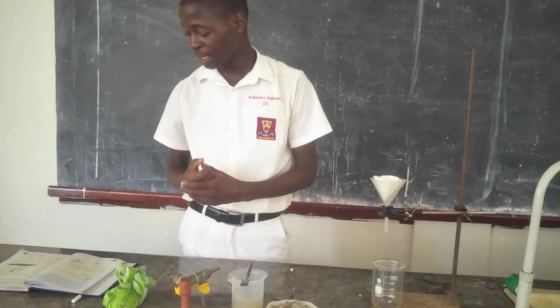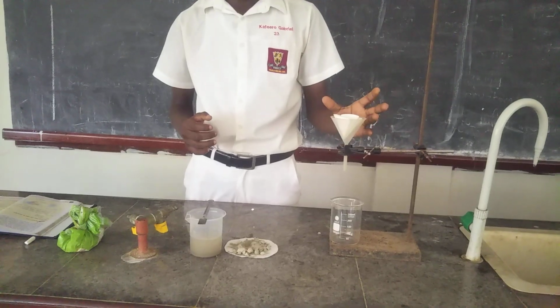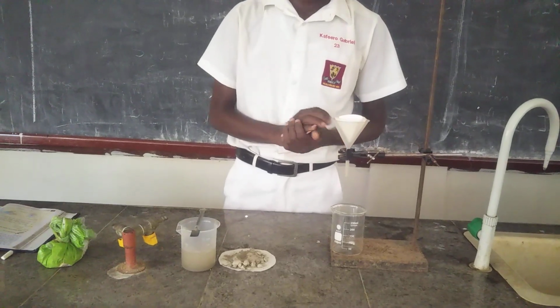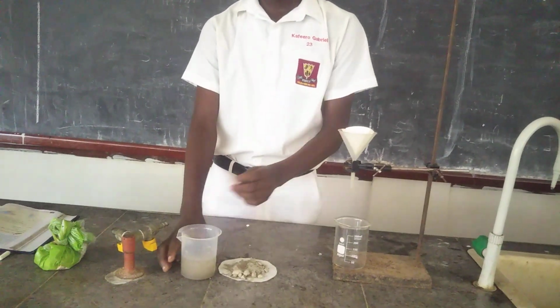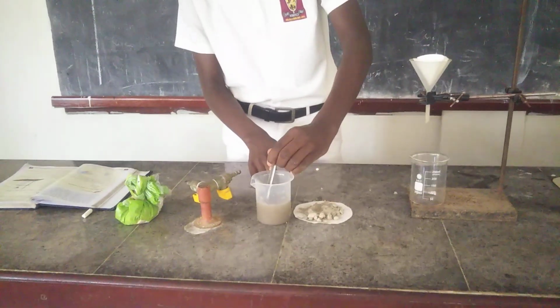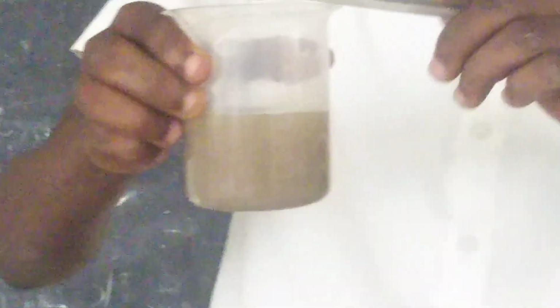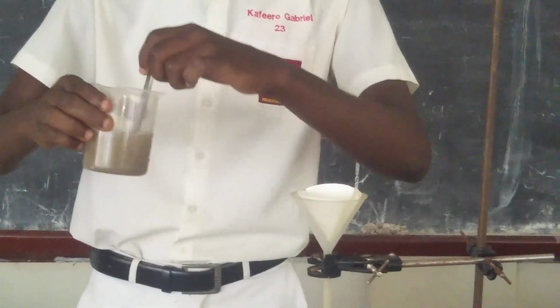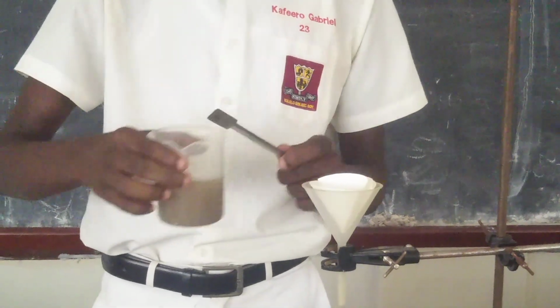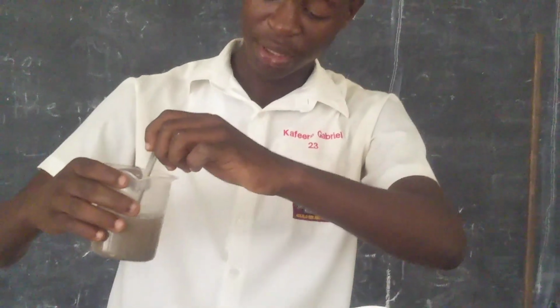They're saying to mix the sand with water again, then pour it into our funnel containing the filter paper, such that we can get our experiment done and our final result. So that's what I'm doing. I will mix again, as we are informed. After mixing, as you can see, they're telling us to pour this mixture of sand and water into our funnel containing the filter paper. I have to make sure that the sand at the bottom also rises.